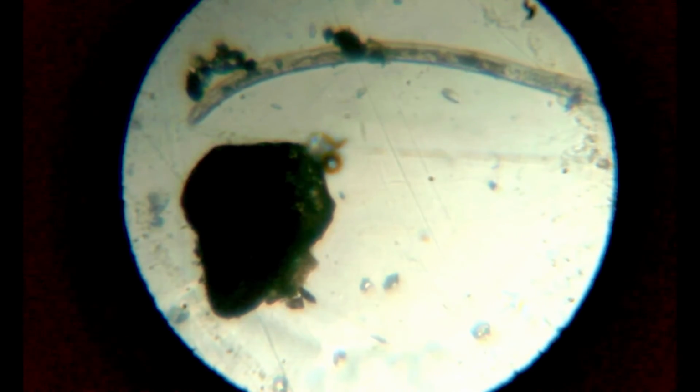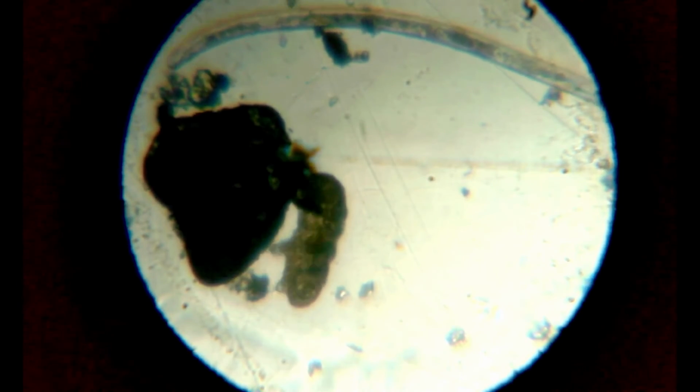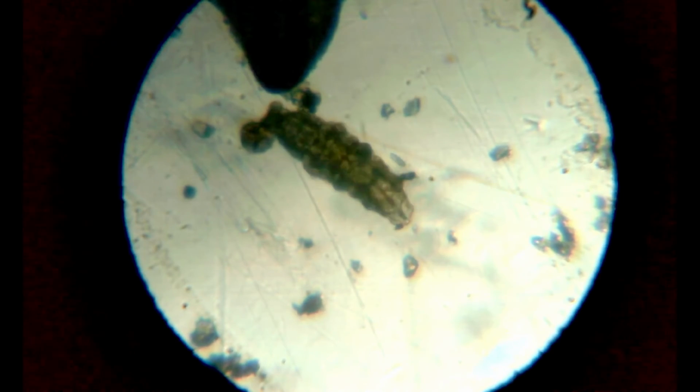After some searching, there it was, a tardigrade. They are so cute, as far as tiny organisms go. You can see the legs and also the fine hair at the end of their legs, and the head and the tail. The tail is essentially 2 feet that are really close to each other, and what you can see moving around are the six main feet, so to speak.